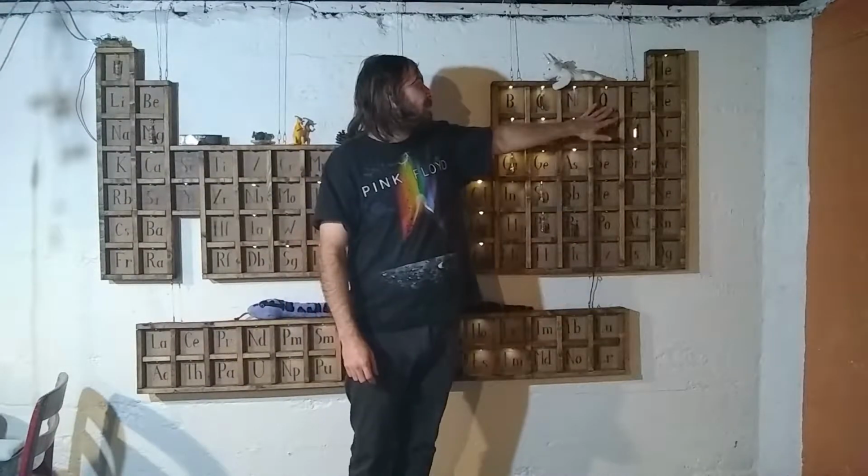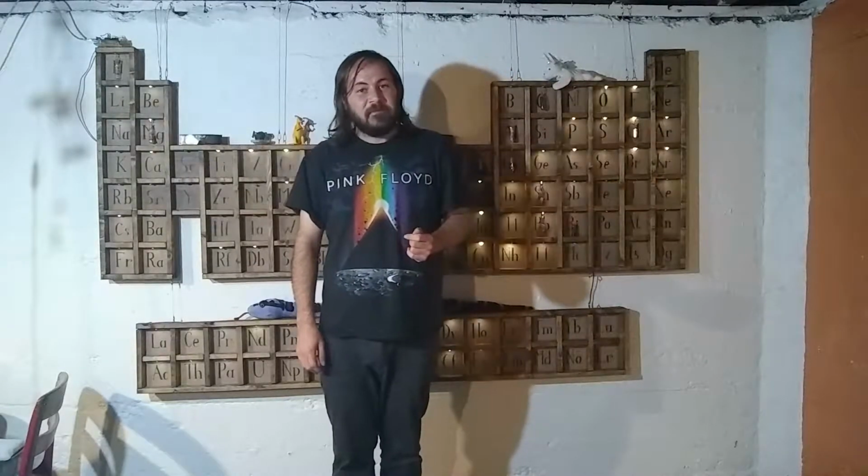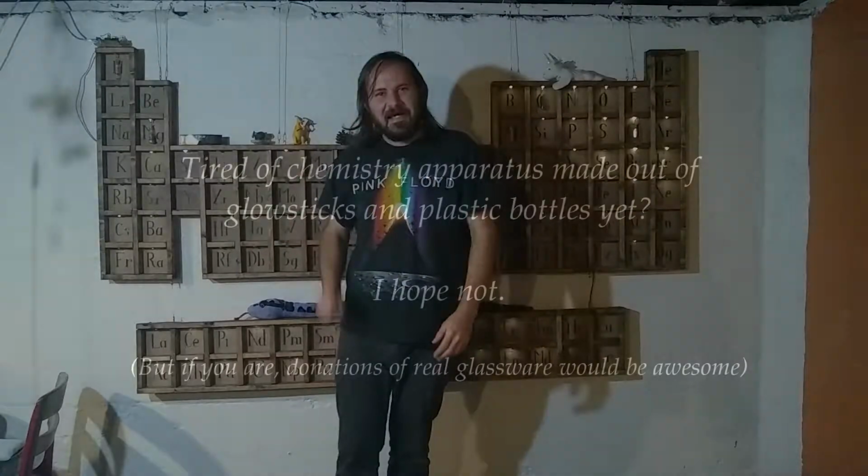So anyway, in this episode, I'm going to liberate pure elemental oxygen from hydrogen peroxide. So let me show you how I did that.